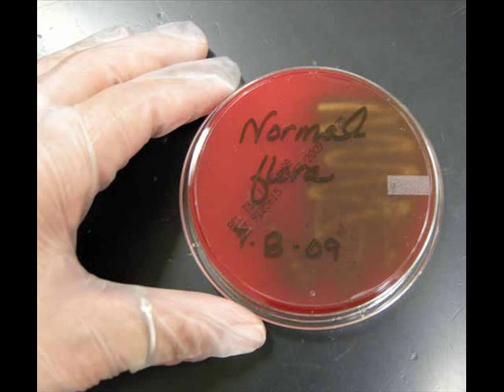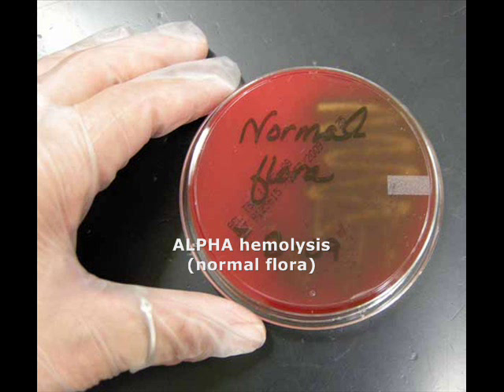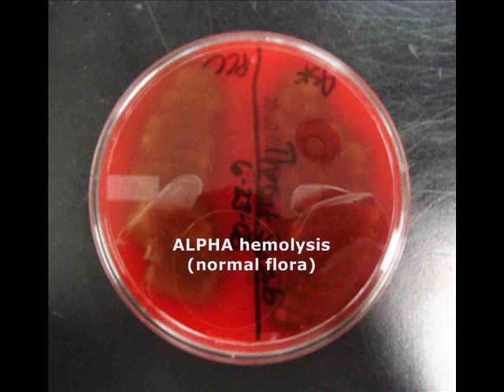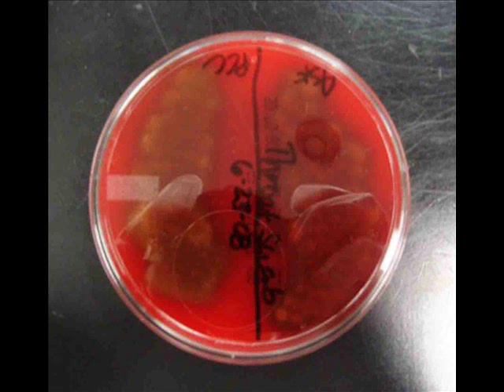Now here's a different blood agar plate that has bacterial growth, and when I look at the bottom of this plate the medium looks bruised — it has a brownish appearance to it. Here's another blood agar plate with the same type of hemolytic reaction. The samples plated on this blood agar were throat samples from two different lab partners, and both show alpha hemolysis — that brown bruising color. This indicates normal flora.